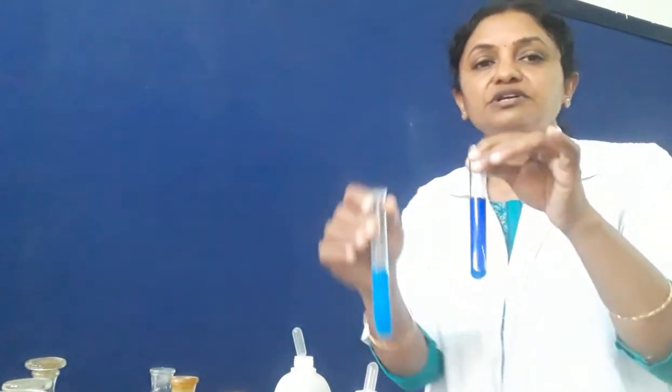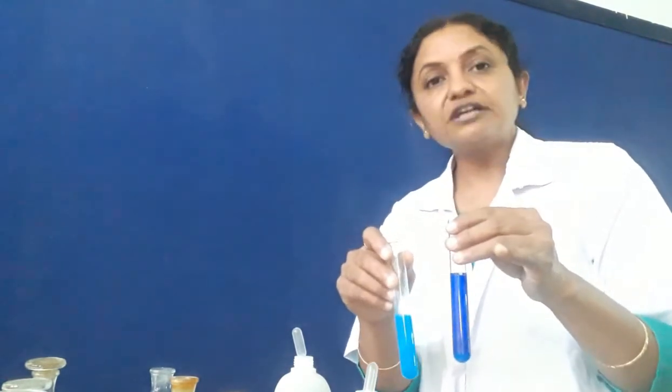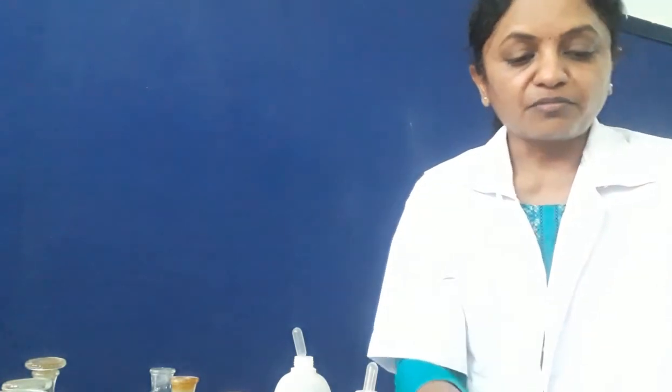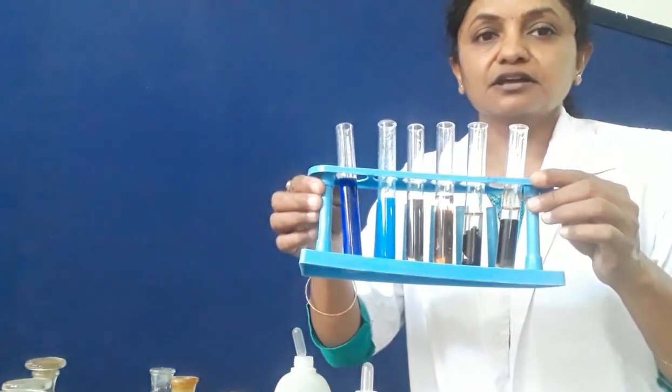See the difference: with NaOH the pale blue precipitate remains, and with NH4OH we get the deep blue tetraamine copper sulfate complex. By this we can confirm that the cation present in the salt solution is cupric. So by the color of the precipitate we confirmed all these cations. Thank you, students.